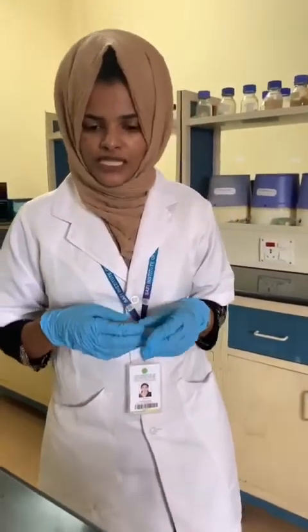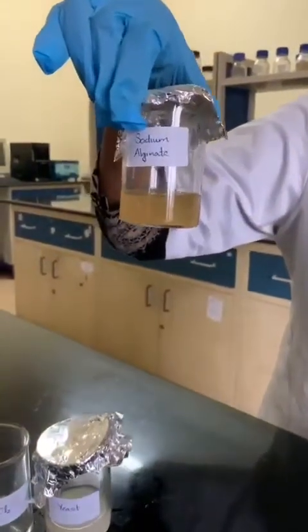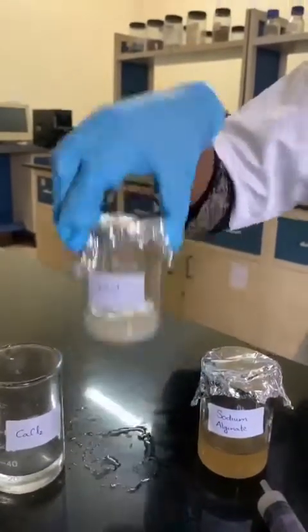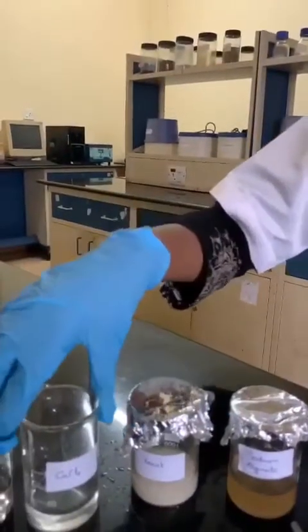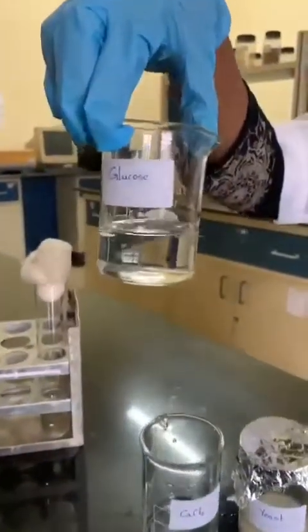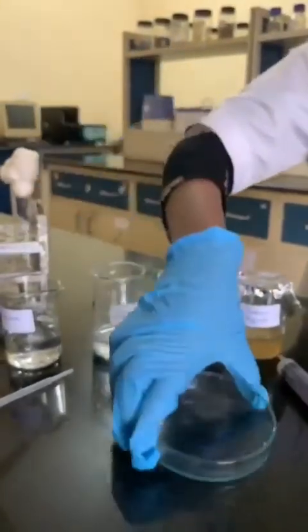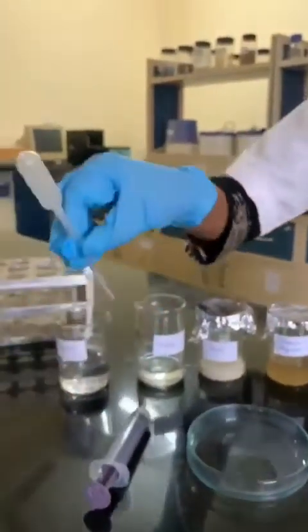The requirements for this are: 4% sodium alginate, 2% yeast, 0.2 molar calcium chloride solution, 3% glucose, a Petri plate, and a syringe or dropper.